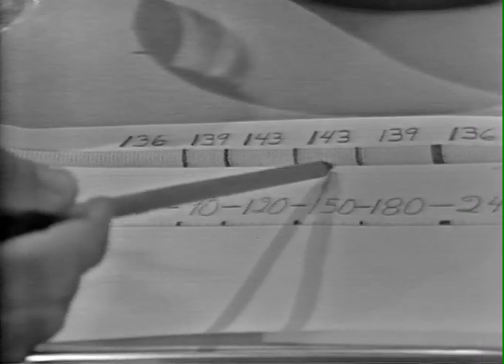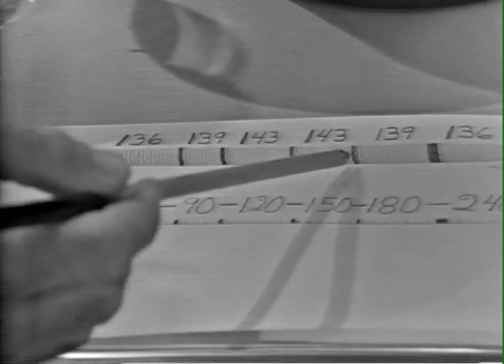It maintained this for a minute or so, and then began to fall off back towards normal. Washing the bath at this point to remove norepinephrine from contact with the tissue, the rate then returned to normal at 125 beats per minute.